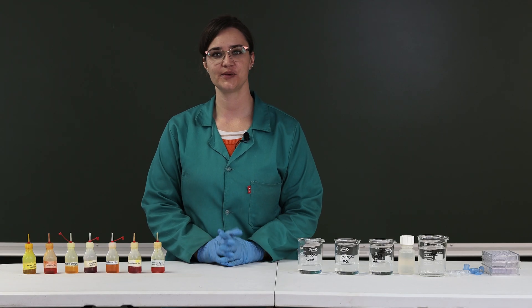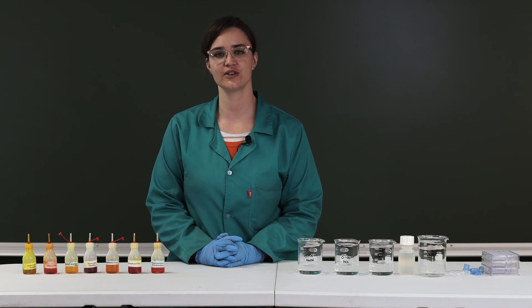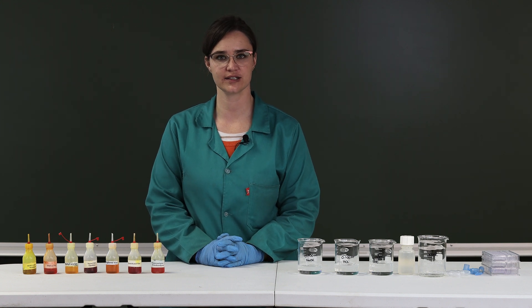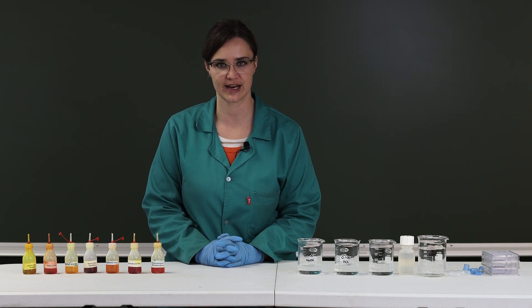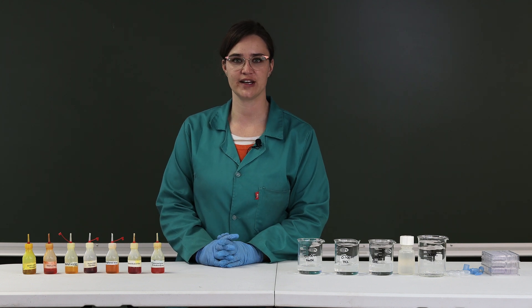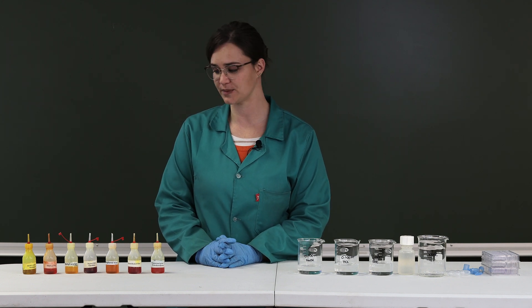Welcome to practical two, where you are going to determine the dissociation constant or Ka of an unknown weak acid. I'm quickly going to go through the apparatus and equipment that we'll be using for this experiment.